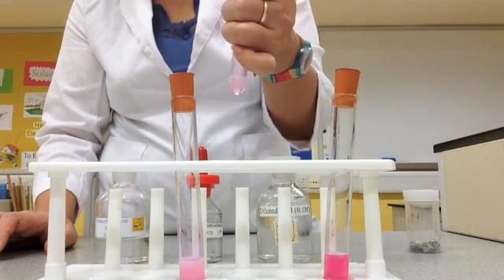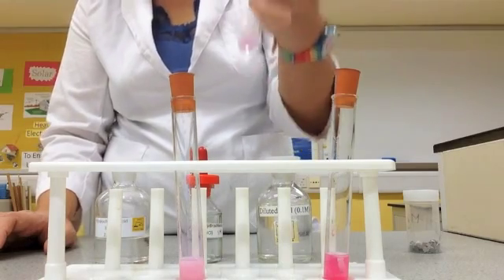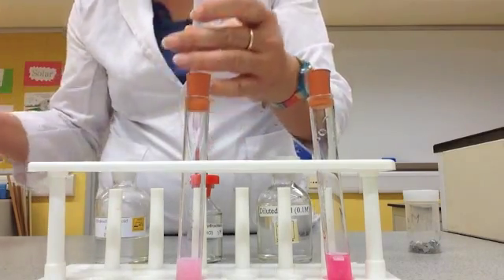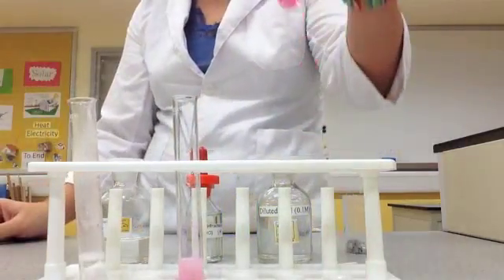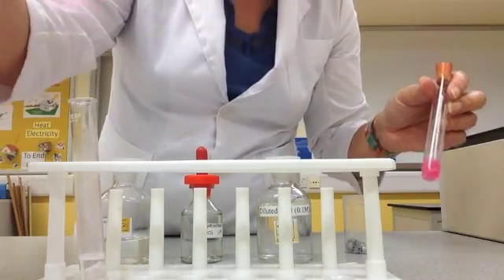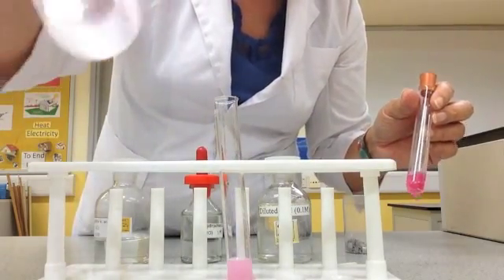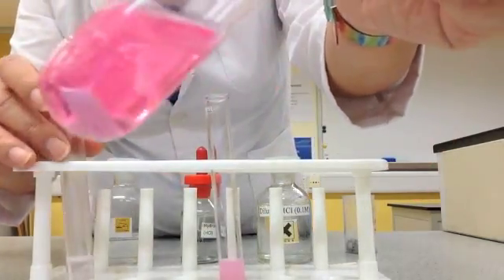As you can see, the stopper went out twice already. I can kind of feel it, so I'm just going to light a splint here and let's see if we can test for hydrogen gas. Not as loud as I wanted it to be, but I hope you heard it — there was a slight pop. Let's check this other one. If you look at this one closely, there's not that much left of the metal anymore. Here it's practically gone — you can't see it anymore. Here, it's like nothing happened to it.